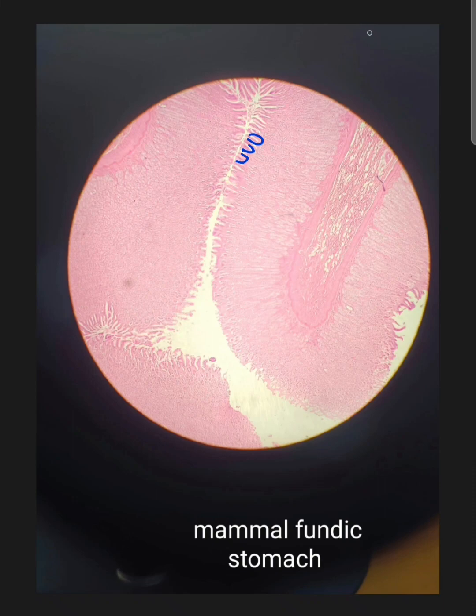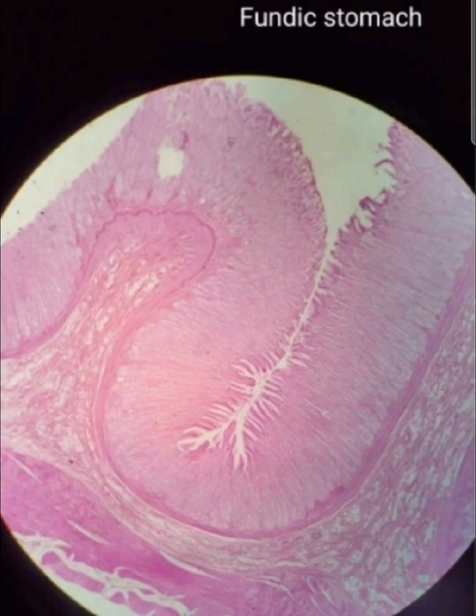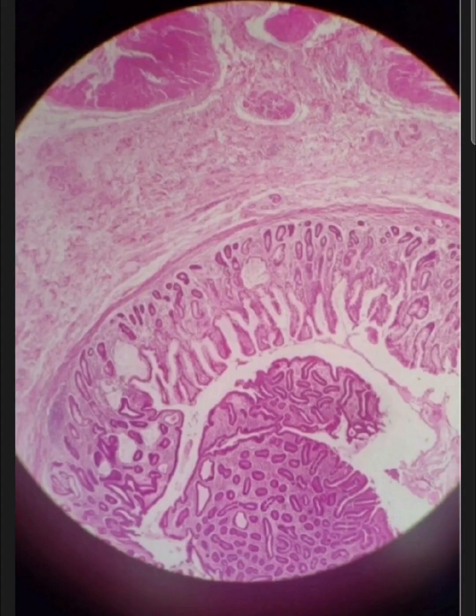then I'll show you another diagram. So this is a clearer picture. I think these are actually the long tubular glands in the mucosa. These are the gastric pits, and then there are layers of muscularis externa, and there are no submucosal glands. So the prominent feature is that there are deeper gastric pits. The gastric pits are comparatively much deeper than in the fundus of the stomach, and there are longer tubular glands, which are basically called the pyloric glands.